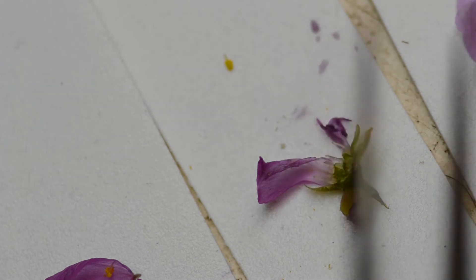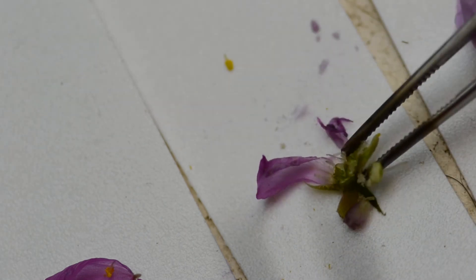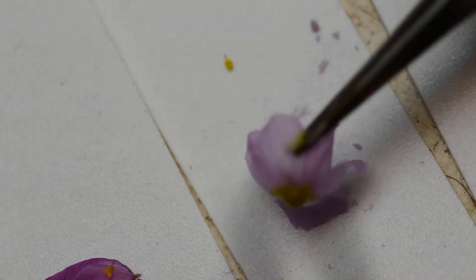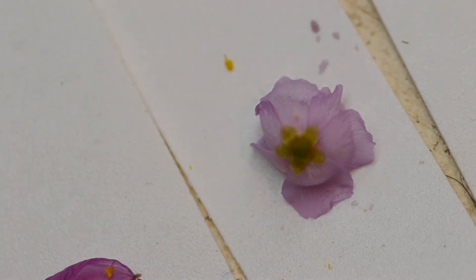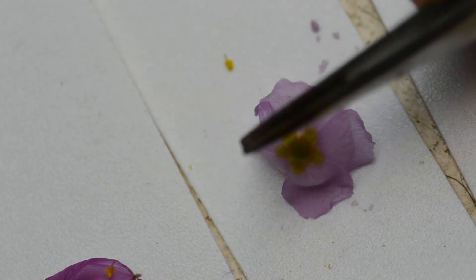And then if we turn around, I have a fresh flower here. So if we look at the bottom, there's these five little green things.